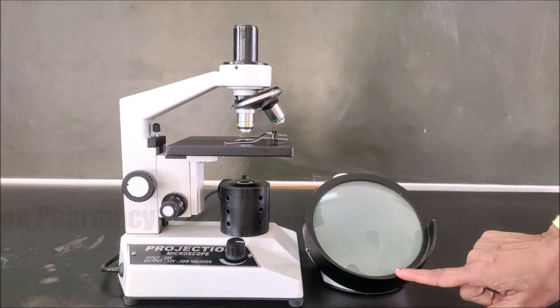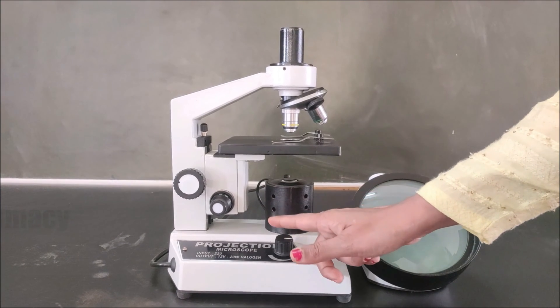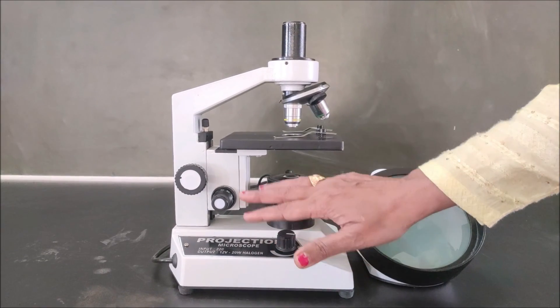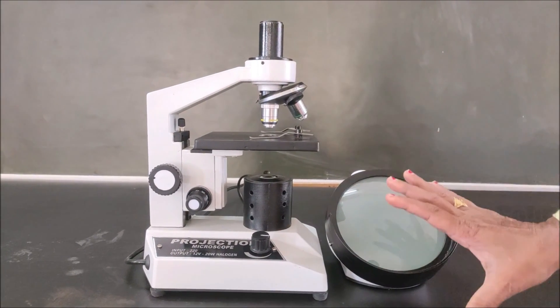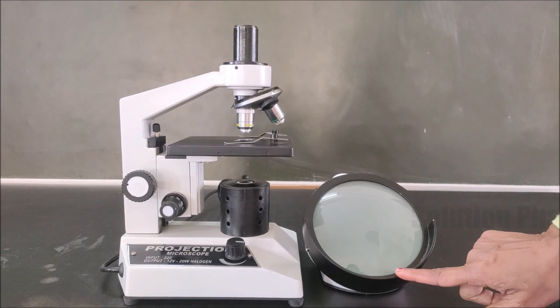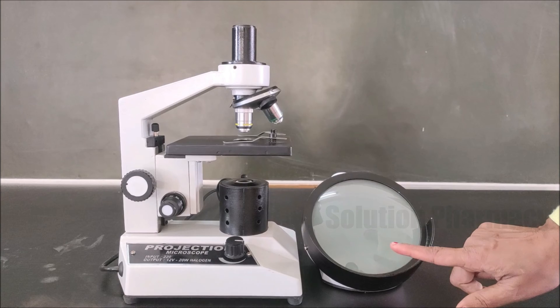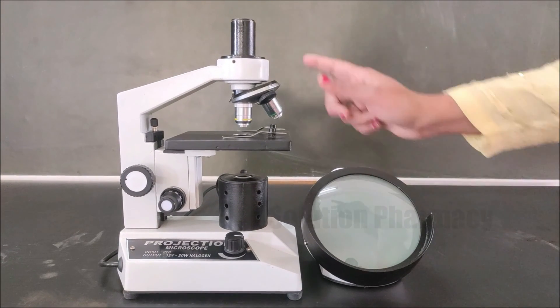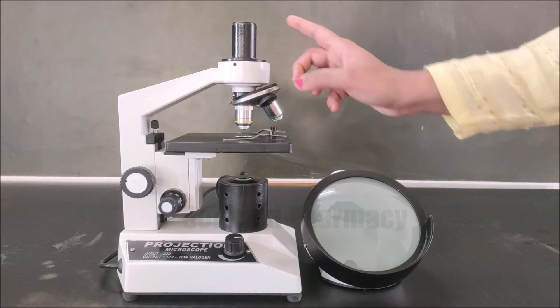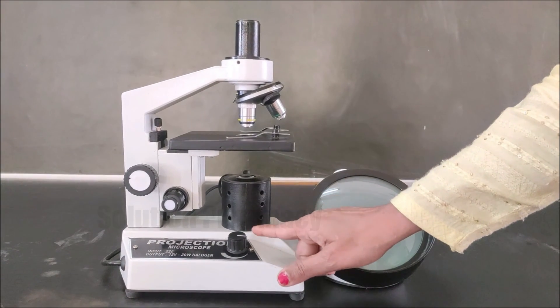So let's start and know about the different parts of the projection microscope. This is the entire body of the projection microscope. This is the circular dome-shaped screen, and we have to fit this screen here in the eyepiece tube. This is the light adjusting knob.